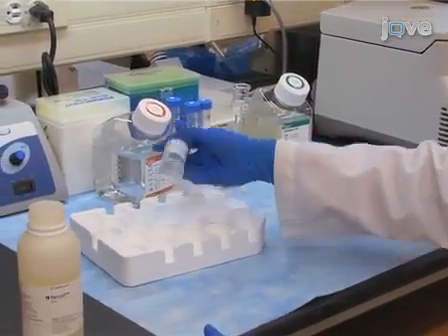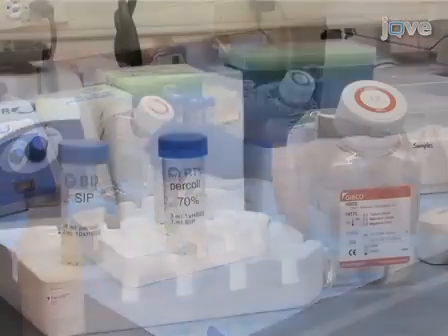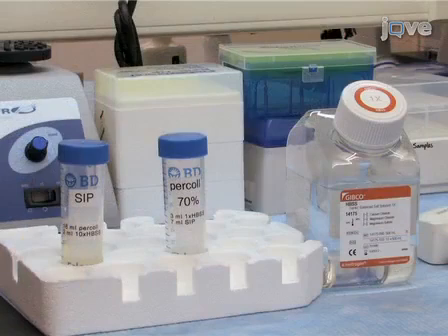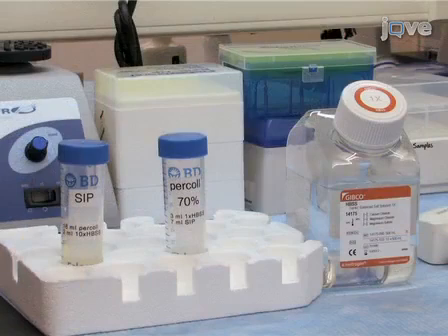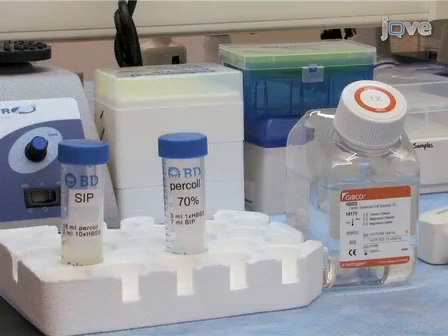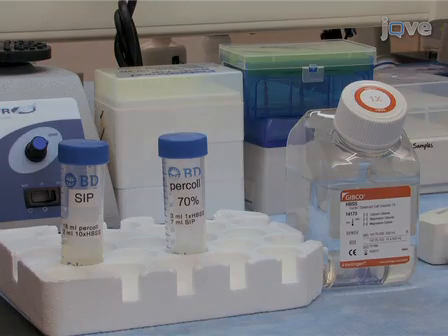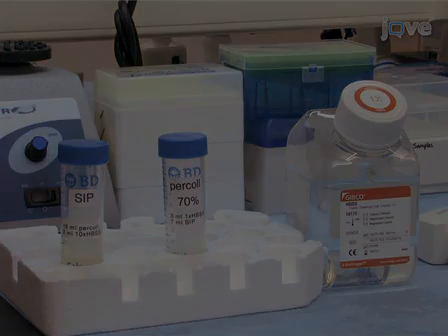Mix by inversion. Next, prepare 70% percoll by mixing the prepared SIP with one times HBSS without calcium and magnesium.